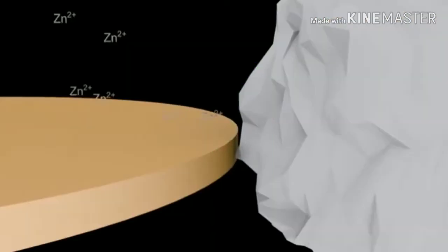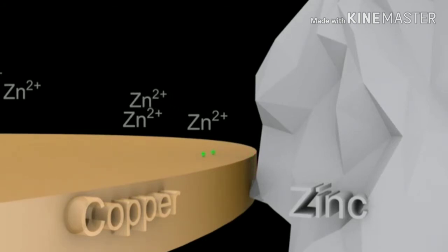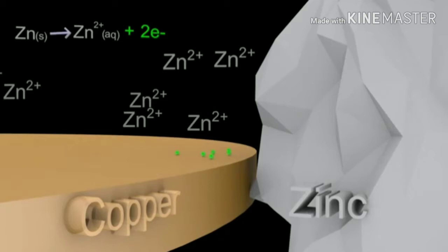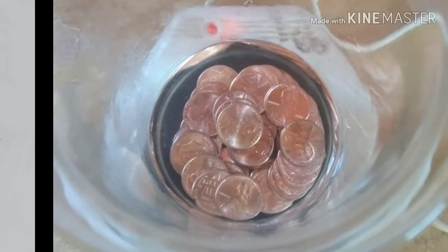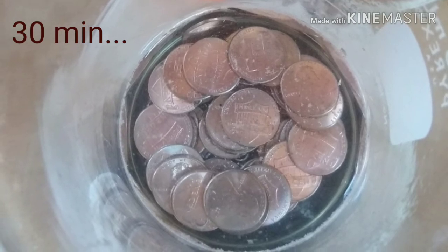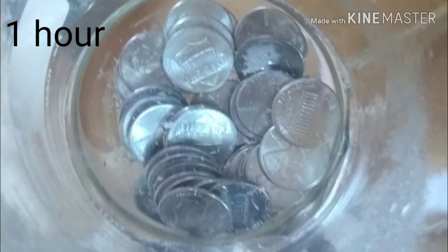Now the fun begins. In this chemical change, little bits of that zinc metal we put in are going to start to go into the solution of sodium hydroxide and water. Those little bits of zinc are going to be attracted to the copper of the pennies and start to deposit — or be attracted to that copper — and create a covering over the copper penny called a zinc plating. This change took place over the course of about an hour, give or take. As you can see from these pictures, the pennies start to look more and more silvery as time goes on. The coating is not actually silver — it's zinc, but it looks very silvery. My silver-colored pennies are zinc-plated pennies.